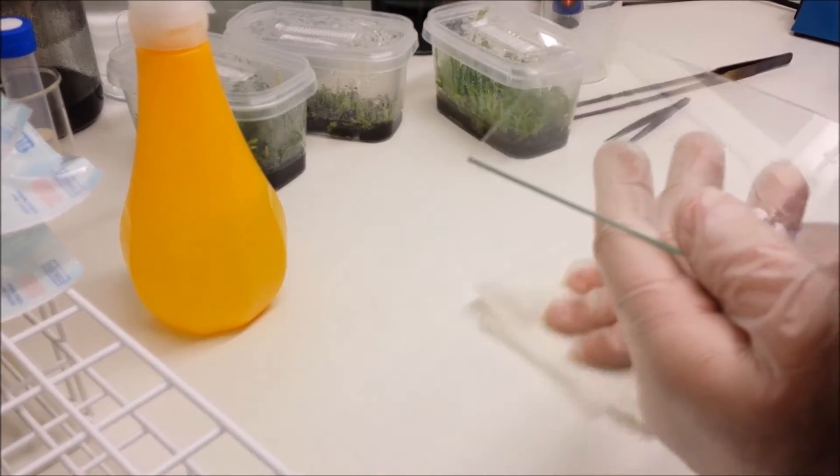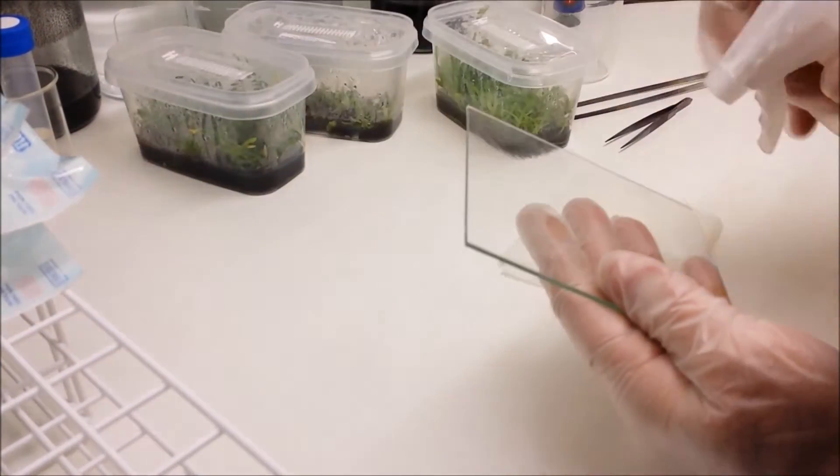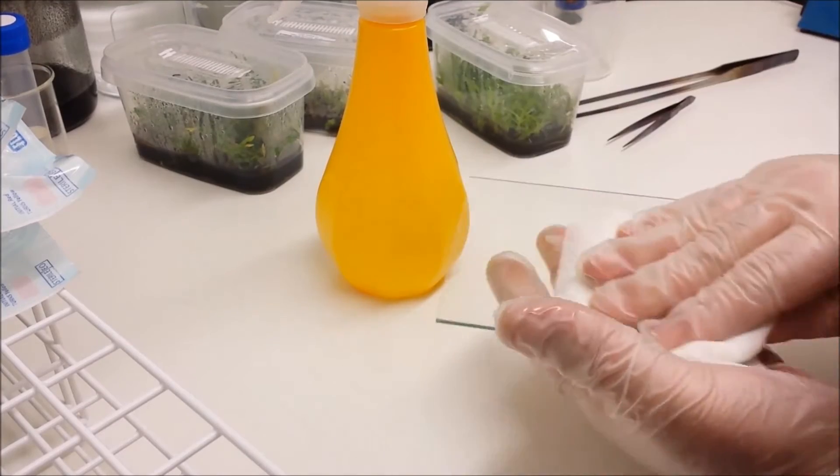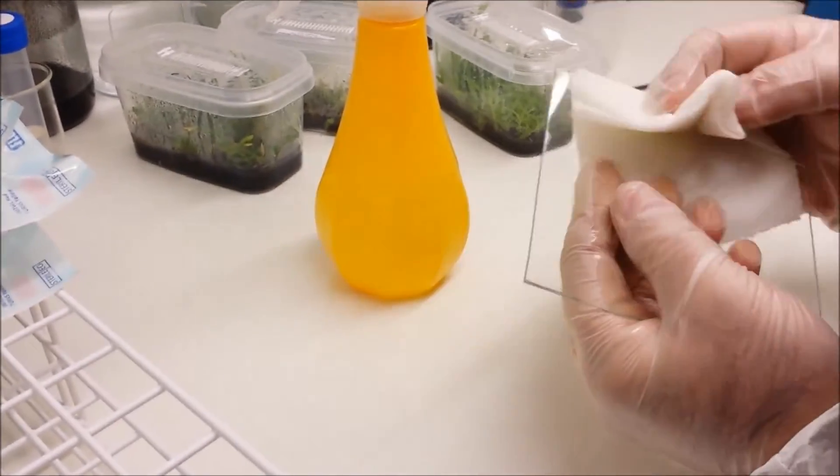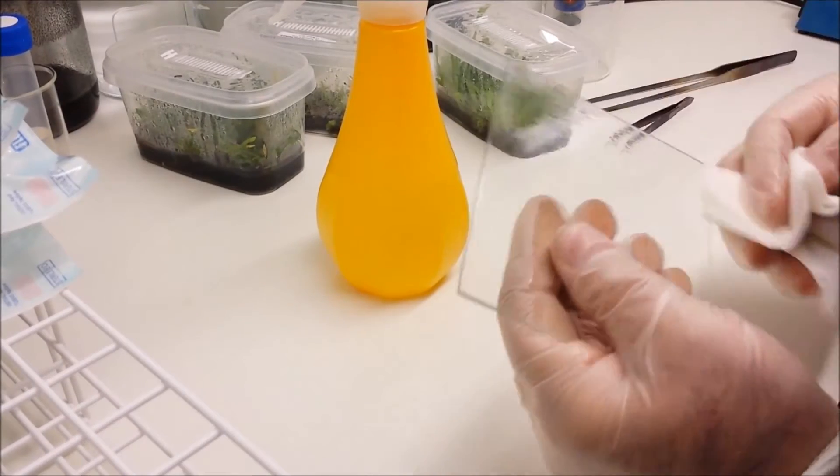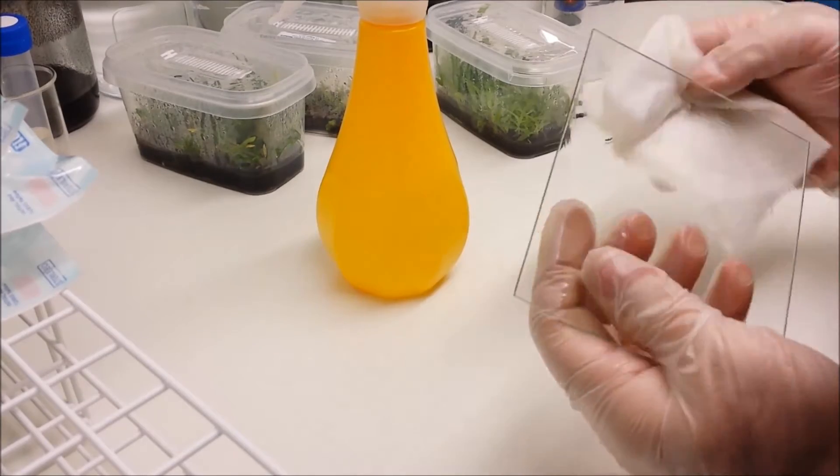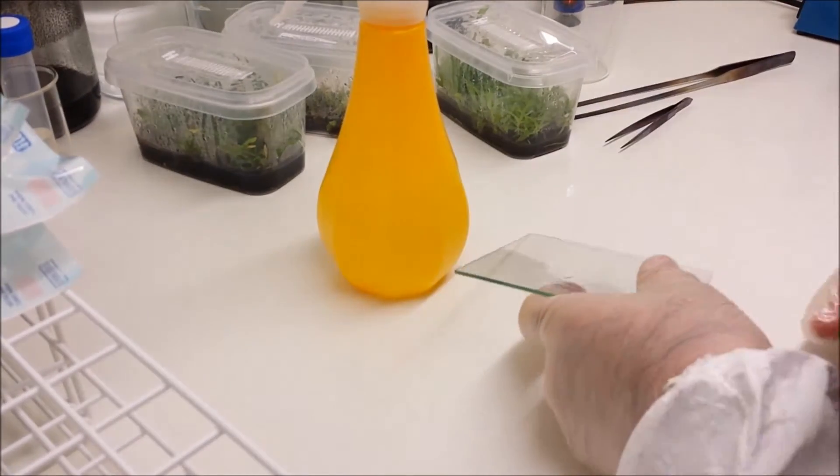You could if you don't want to use a piece of glass you could use a petri dish. So let's spray it all over with IPA and wipe it right down. This includes the edges all the way around. You don't want no bacteria in this environment whatsoever. So place that down on the sterile surface again.